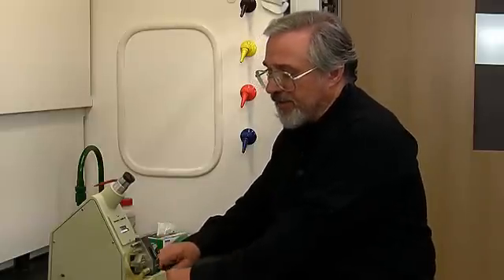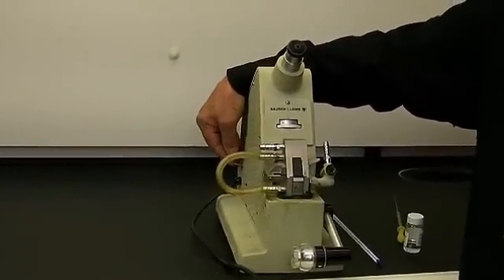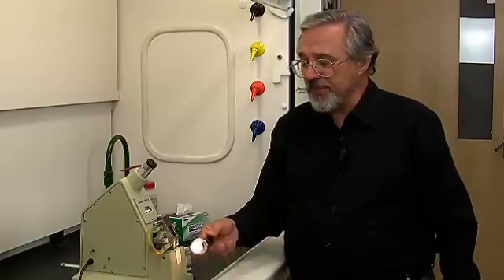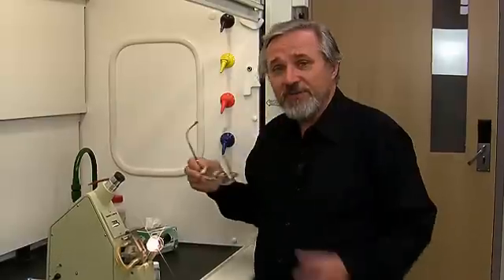So we've done that. Now we're going to turn on the lamp. The lamp is activated by a toggle switch on the left side — right now it's in the up position. When I put it into the middle position the lamp goes on. I'm going to raise the lamp now to the level of the prisms.